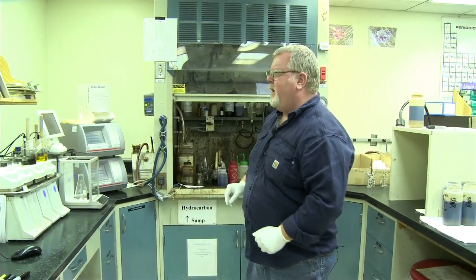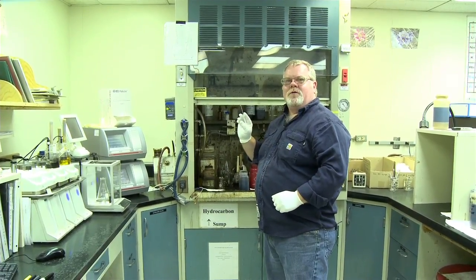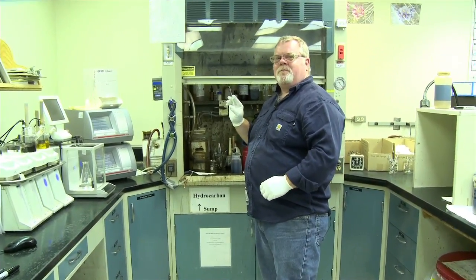We don't have a good ability to match well temperatures, and if you just ask for viscosity, we have a set temperature that we typically operate at, so most of our data is at about the same temperature. So I have a sample mixed here, and I'll show you how we load the densitometer and basically how it works.